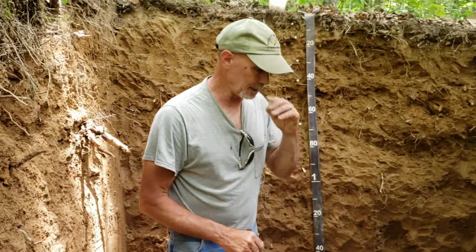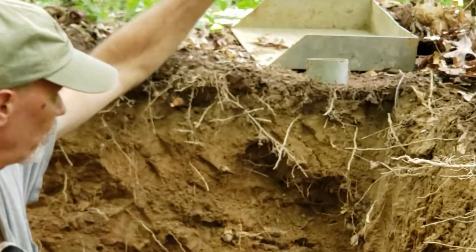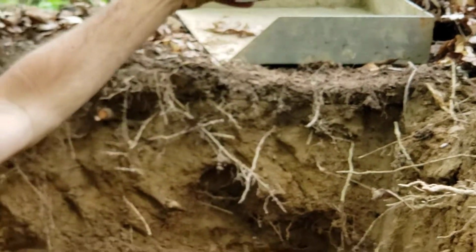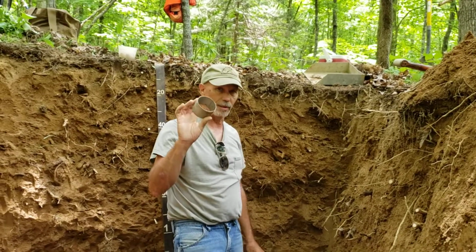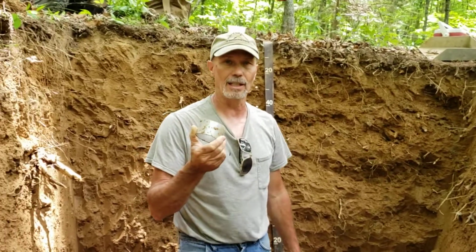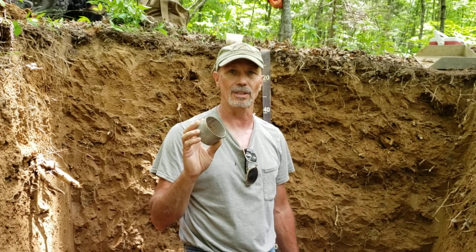We sample surfaces from the top with the ring, which is a little different. We'll put the ring on the surface like here, and then we'll pound that into the surface with our block and our hammer, and then we'll just pull that out that way. So you can take samples horizontally or vertically with the ring, either way. And so that's how we use the bulk density ring for sampling. So that is our video on sampling today, and we'll do a video sometime soon on how to sample using clods for bulk density. Thank you.